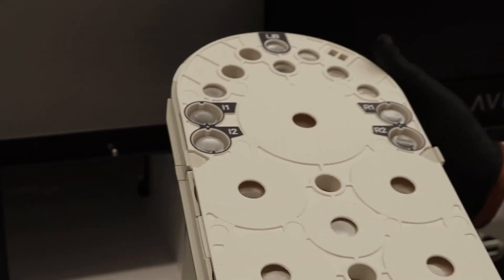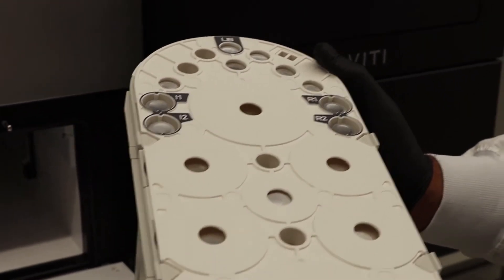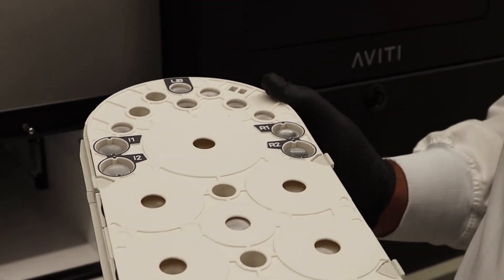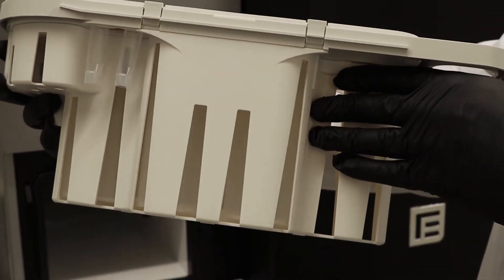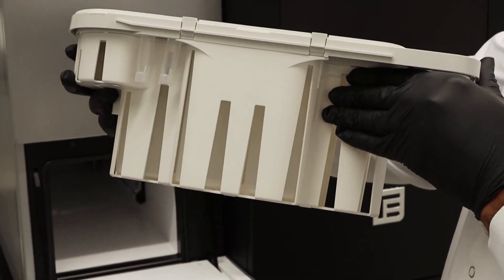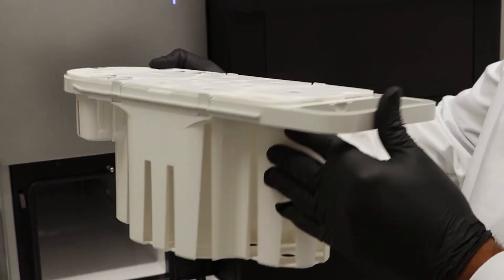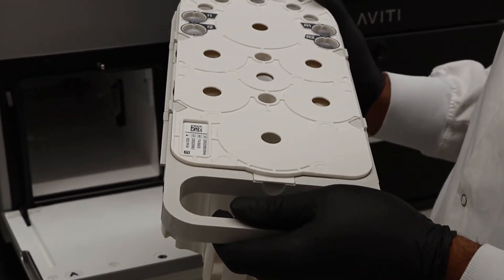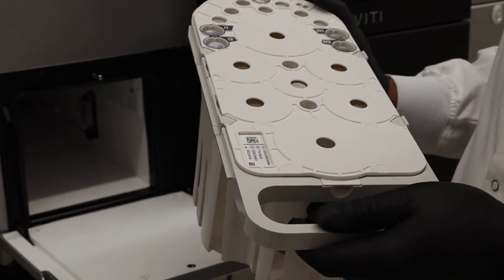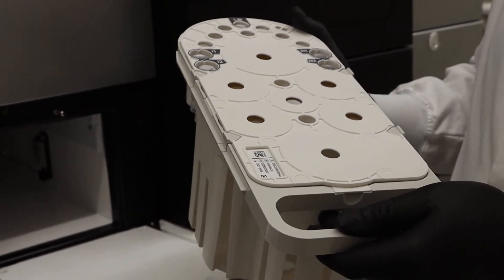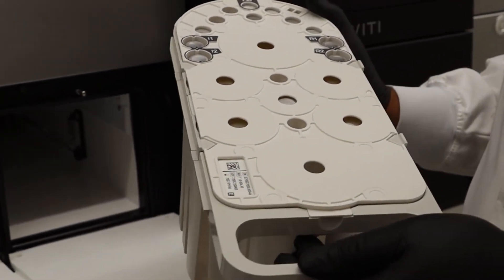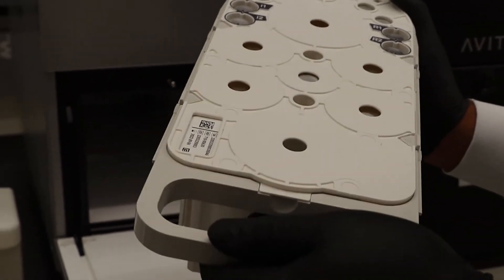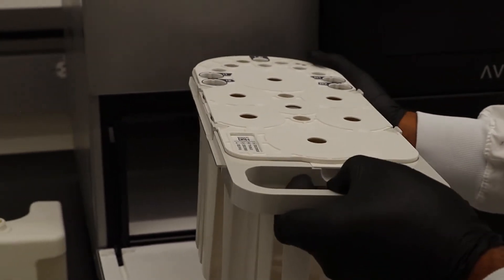Generally, when you arrive at the sequencer, you will bring the sequencing cartridge from the lab bench in these baskets that you see here, for easy handling and fit into the Aviti. The cartridge takes less than three hours to thaw in a 20 degrees water bath. And if you actively regulate the bath, it can easily take less than two hours. You have already prepared the cartridge and diluted your loaded library before you are here.